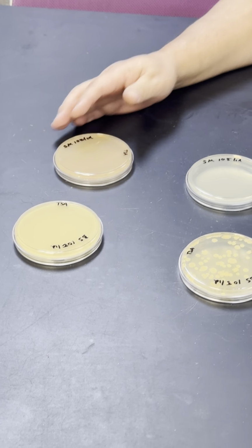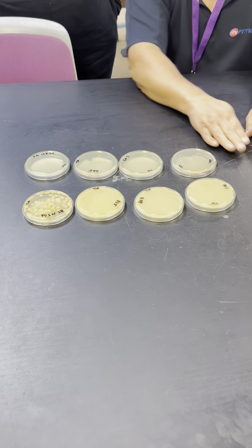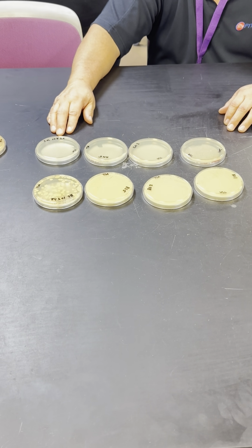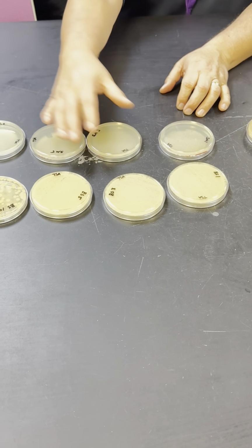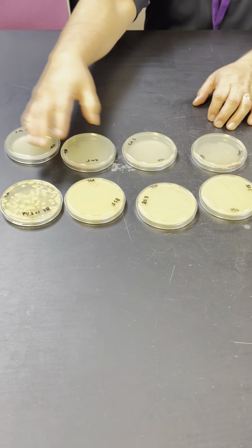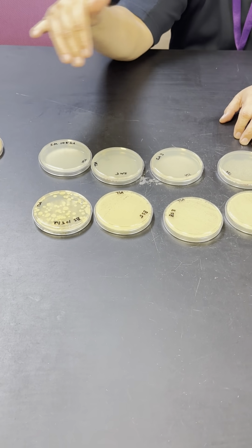The other thing to consider is with Serratia marcescens, that even after 1 minute, but probably at 30 seconds, I didn't do it at 30 seconds, you can see that almost everything was destroyed. Except for, in some cases, at the very edges, you can appreciate that there is, even at 5 minutes, growth. Not at 10 minutes, just because I didn't get lucky enough to get growth at that.